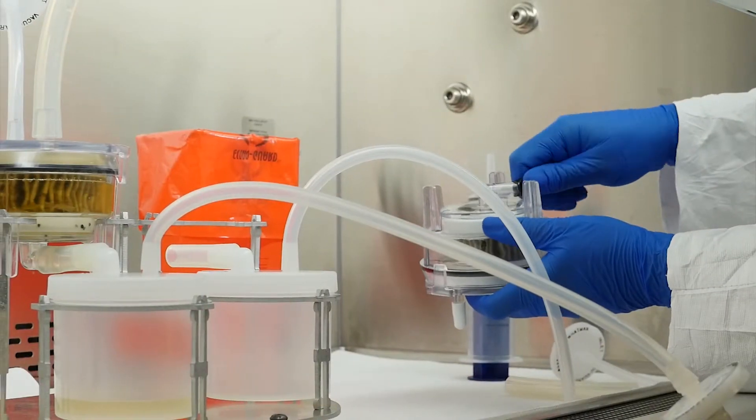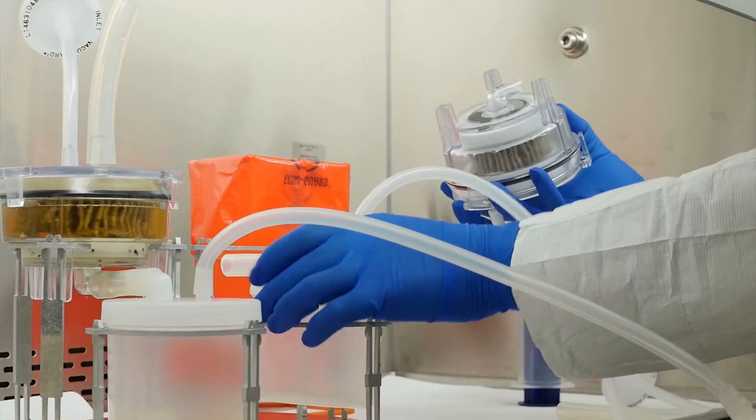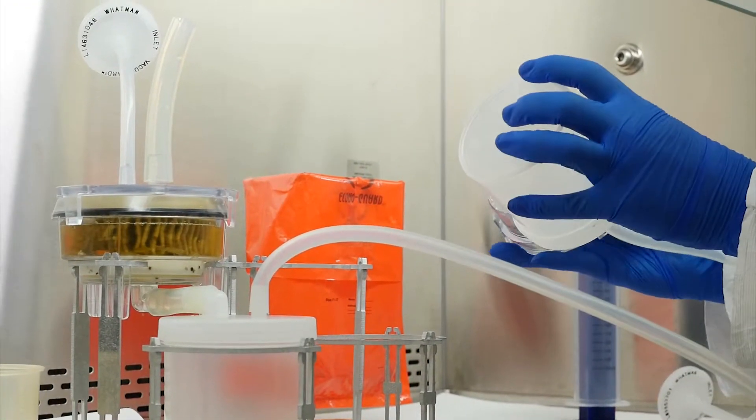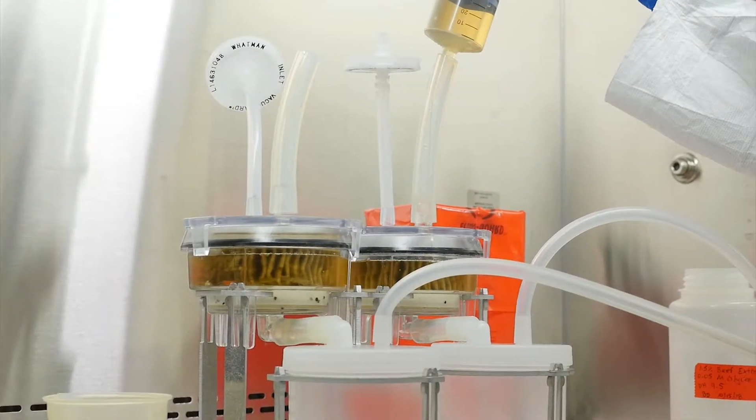If you are eluting a second filter, set up your filter and collection cup and inject the eluent seven minutes after eluent injection to the first filter. This will enable adequate time for pumping between samples.